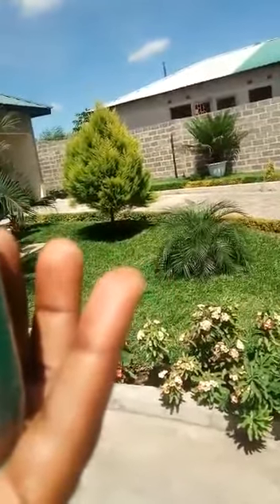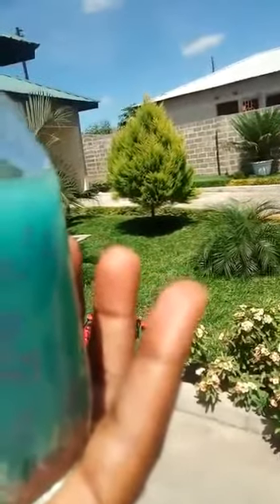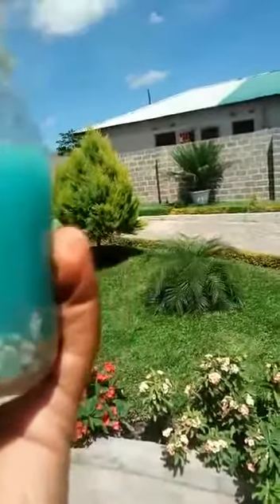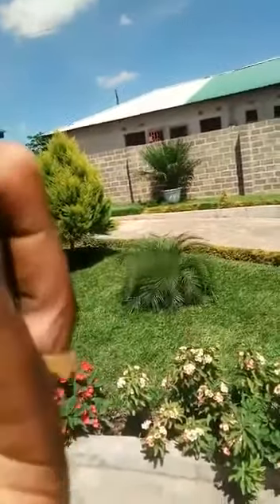As the reaction proceeds, because of the consumption of the acid and generation of water, the pH of the solution becomes higher and higher from the low pH because of the addition of the acid. So let's see how it's going to happen. All this blue stuff you're seeing underneath in the solid particles, the green stuff, will disappear as the copper continues reacting with the acid.